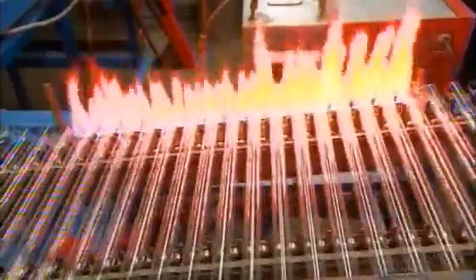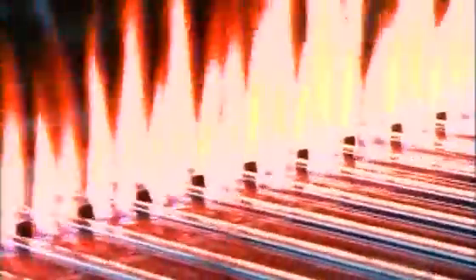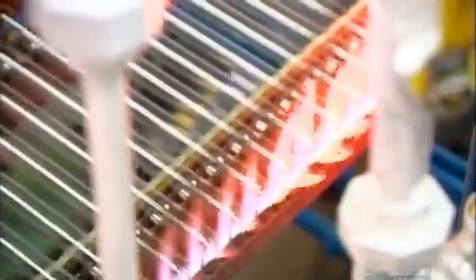Then it's onto the glazing bed. A glazing burner shoots out flames at a temperature of 650 degrees Celsius. The heat melts each tube at one end, forming a lip called a glass bead.